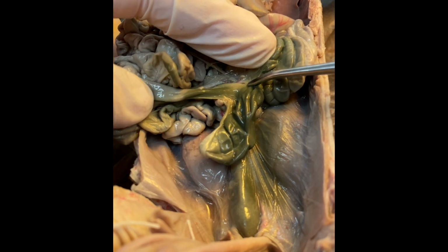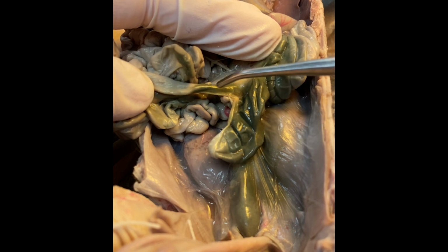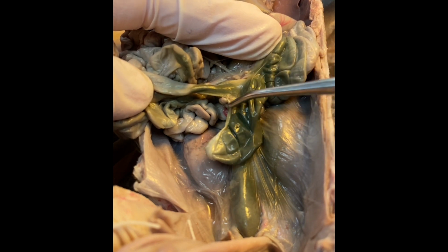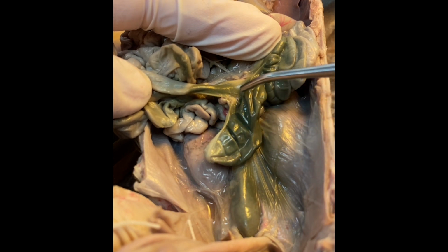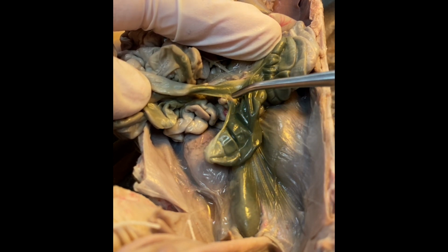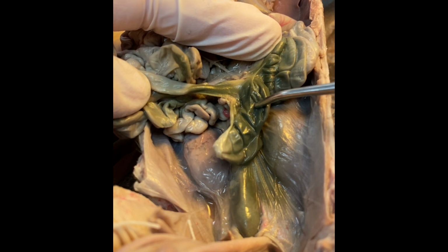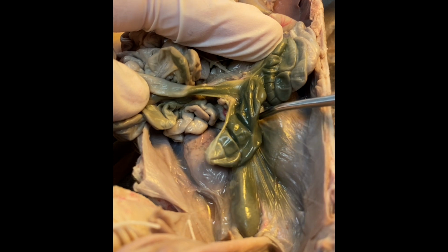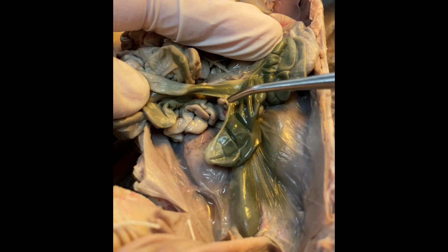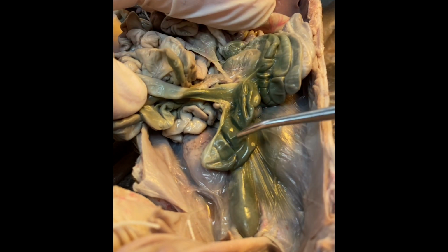So the portion where the ileum runs into the colon often looks like a T structure. There is a dead end region here that's referred to as the cecum. The cecum is a lot smaller in omnivorous and carnivorous organisms because this is the area that we would digest more of the fibrous material. If you were to look at a rabbit, for example, this end would be much larger.